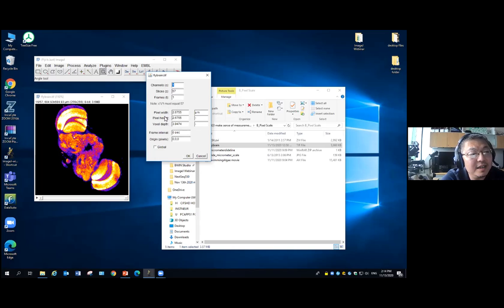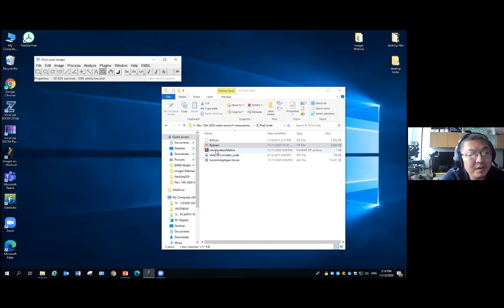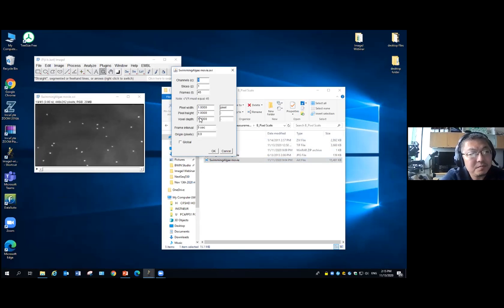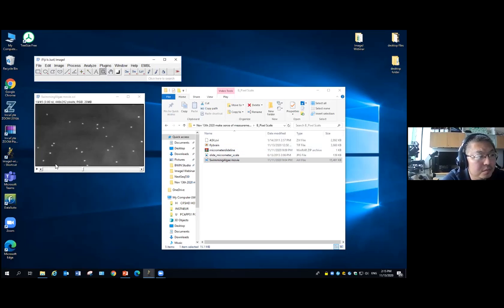So not only the X, Y, Z information, even if you have a time series, like here we have a swimming algae, this is a time series. You can also do normal time series, like a calcium flux. But once you keep the raw data, you can always use the image properties. It doesn't save the pixel scale, but in this case, it saves the frame interval. So we know that the time between one frame and the next is 5 seconds.